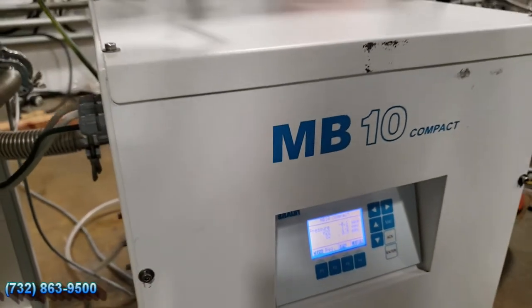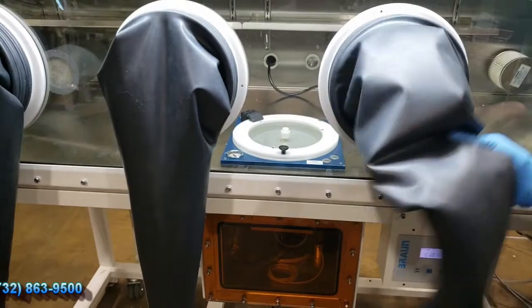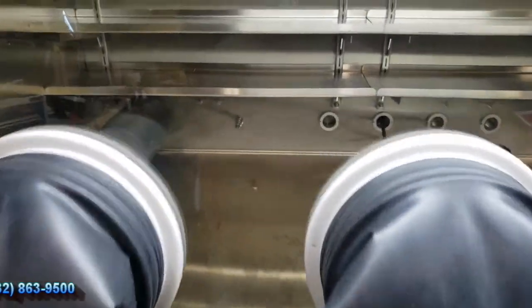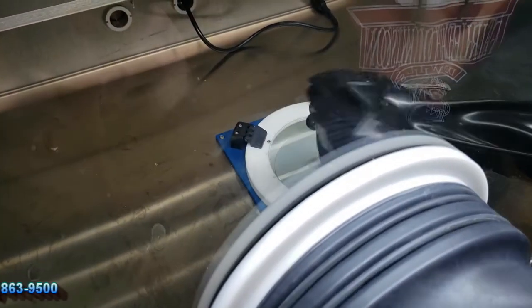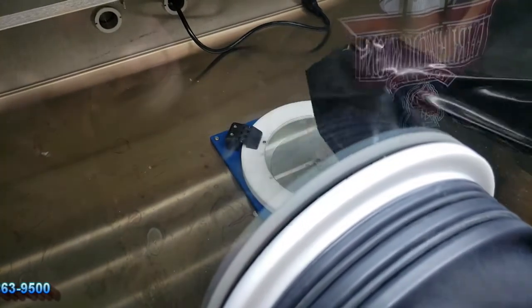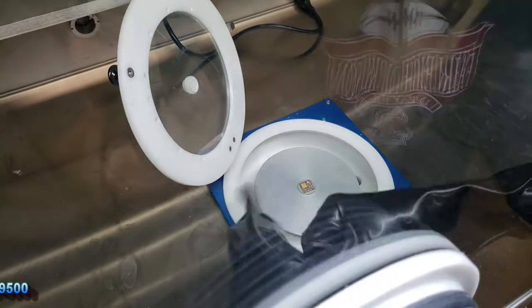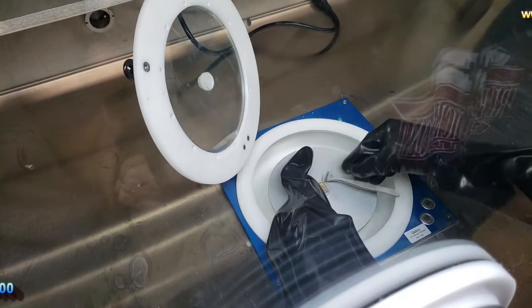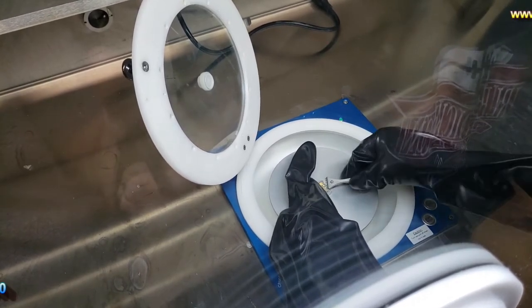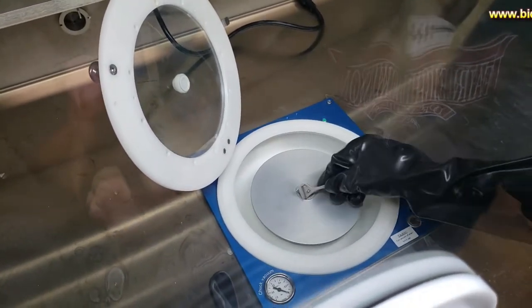What we'll do next is we'll go ahead — I have a little device set up on the spinner. These are ambidextrous gloves so you can use them for either direction. So you do have a lid here. It's easier if I use this little tool here. I have a device set up here — this is a one-inch chuck, rectangular square chuck set up. You can see the opening right here, this device fits in there perfectly. I'll go ahead and place that on there.